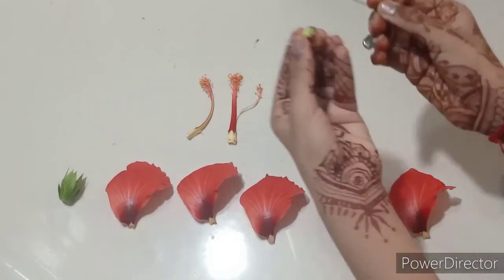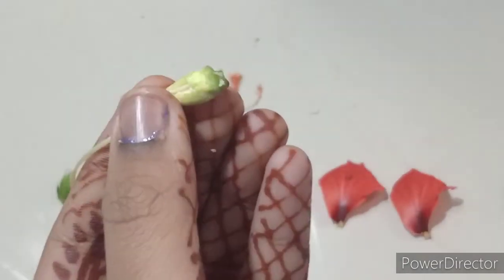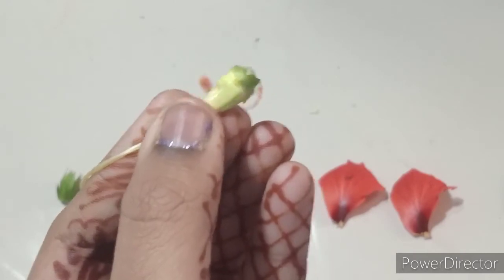As you can see here, I have obtained tiny ovules. I'm not so sure if the camera captured it properly, but there are tiny ovules inside the ovary.